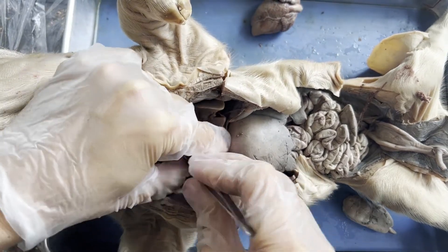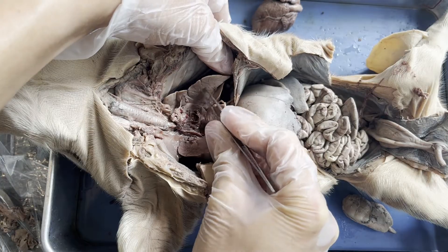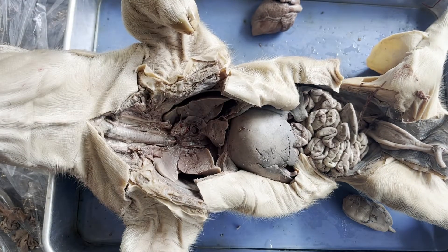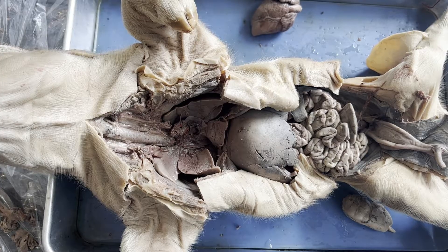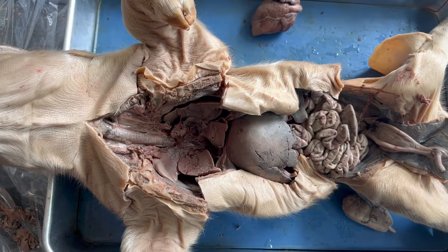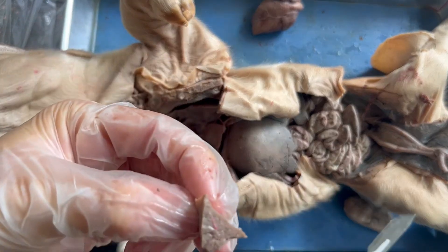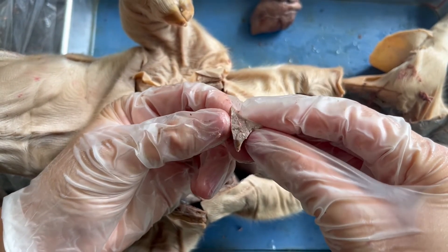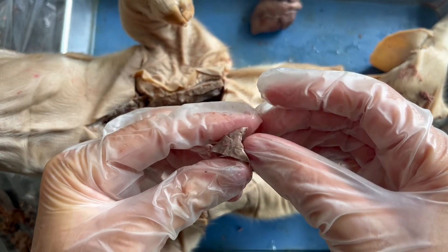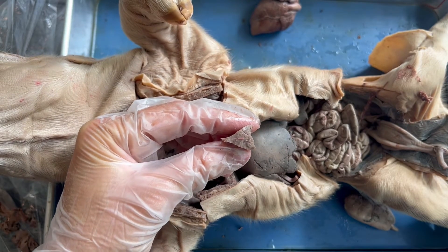Inside the lungs, each bronchus is going to split into smaller and smaller branches, and then those branches are going to end with alveoli — those little air sacs where we have external respiration happening: oxygen flowing into the blood and CO2 passing into the lungs. If I use a scalpel to make a small snip in one of the lungs, you can see the inside tissue is not hollow — it's completely dense. There are little tiny openings where larger bronchioles or blood vessels went through, but really our lungs are very dense, with teeny tiny narrow tubes and air sacs inside: the bronchioles and the alveoli.